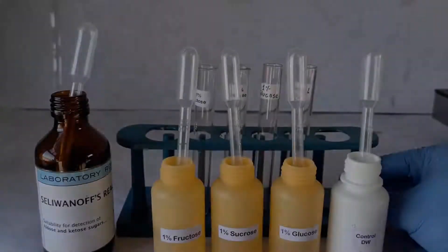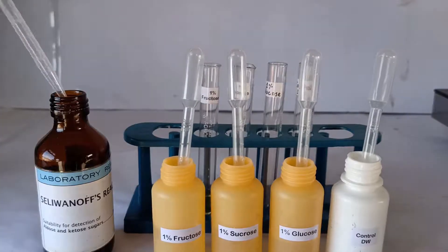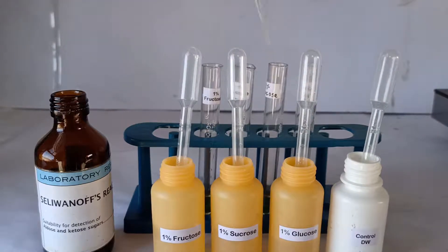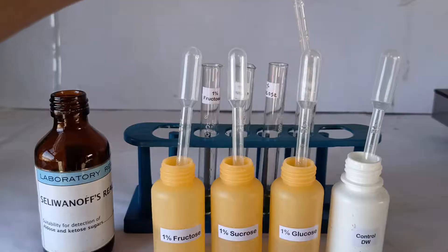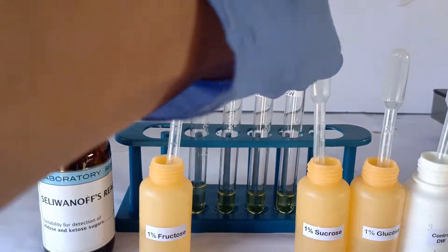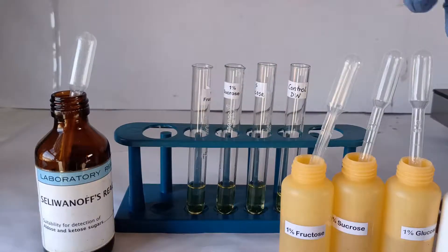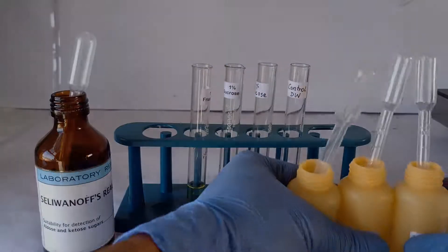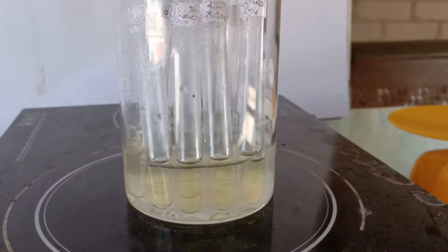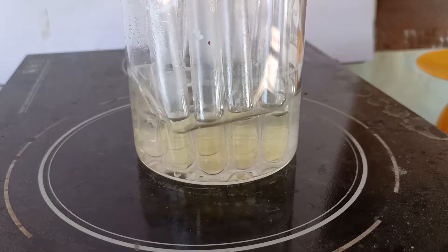To begin the test, take the 4 labeled test tubes in the test tube stand. Add 2 ml each of Seliwanoff's reagent to the test tubes. Now using 4 different pipettes or droppers, add 1 ml each of the fructose, sucrose, and glucose samples and 1 ml of distilled water to the corresponding labeled tubes. The 4th test tube with distilled water will act as the negative control for this test. Now keep the test tubes in a water bath for 1 minute or so, and observe the appearance of color or the lack thereof in the tubes, noting the time taken for the colors to develop.